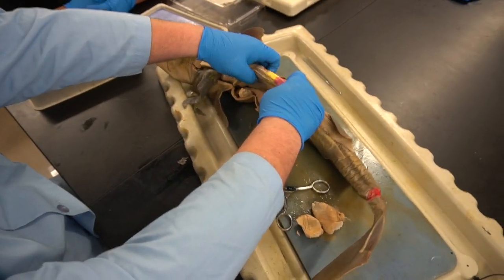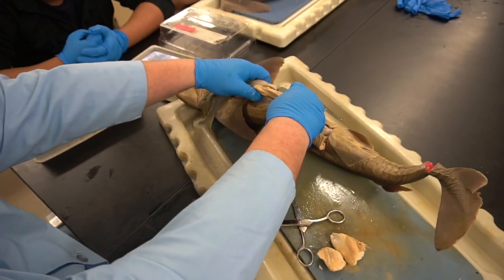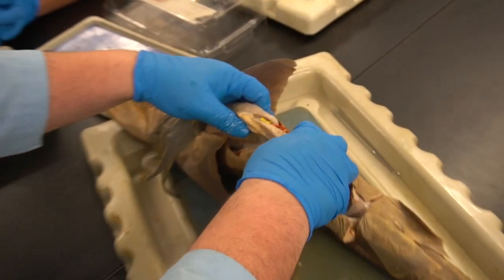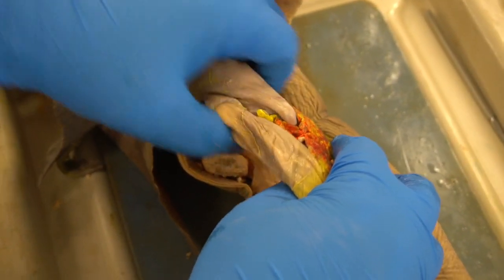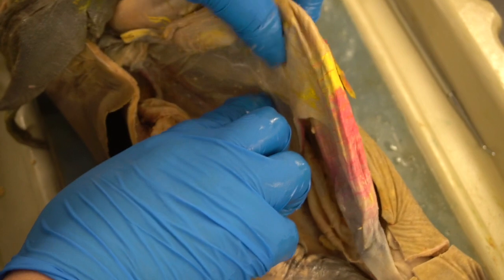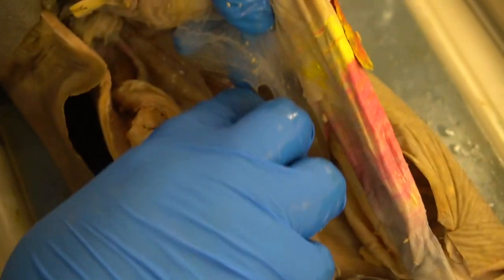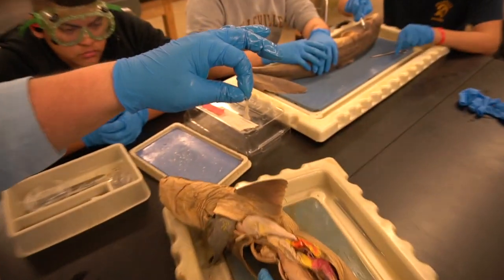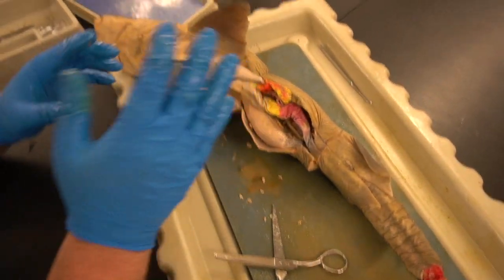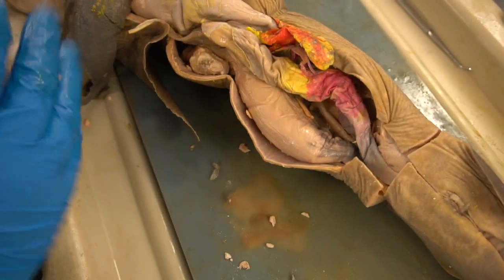You can see here in the lower part of the system, see this thin wall here of connective tissue? It's almost like it's translucent. Okay, this is called the peritoneum. Okay, this holds everything together. It's very easy. If I stretch it, I can just poke through it with my finger. Okay, it's not very cellular. It's almost like saran wrap in a way. Okay, it's very thin. It's a sheet of tissue. All right, and that holds everything. So the intestine isn't just flopping around inside. It holds it loosely to the body wall, so it kind of stays in the same spot.